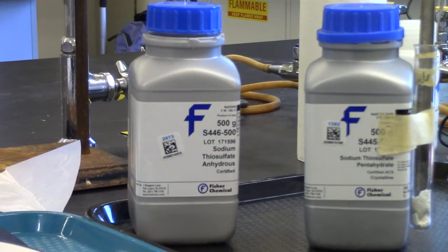We will repeat the procedure using five grams of sodium thiosulfate pentahydrate.